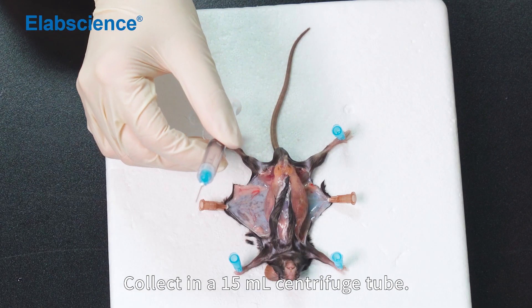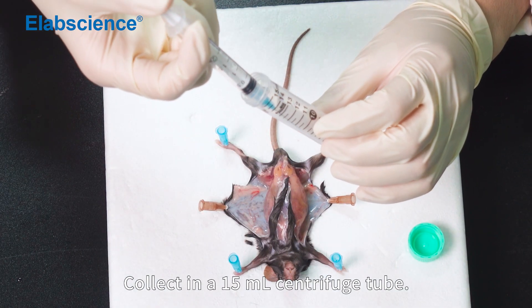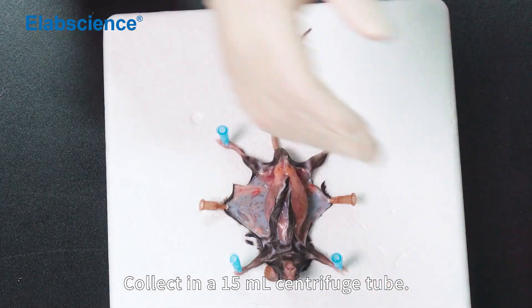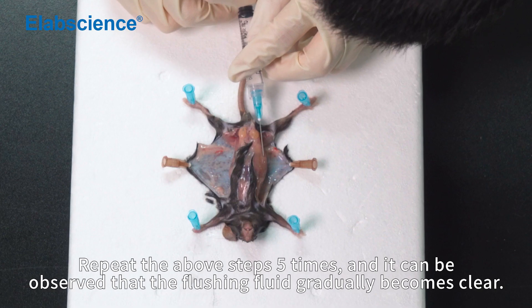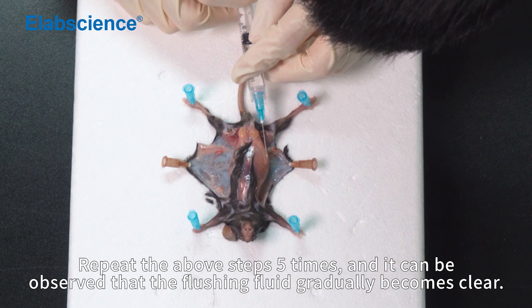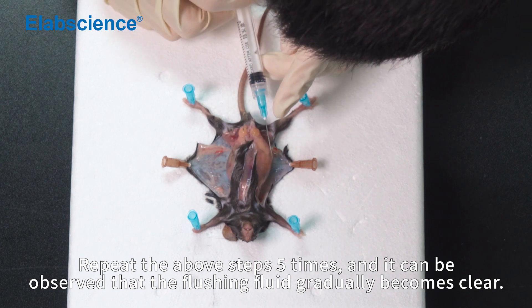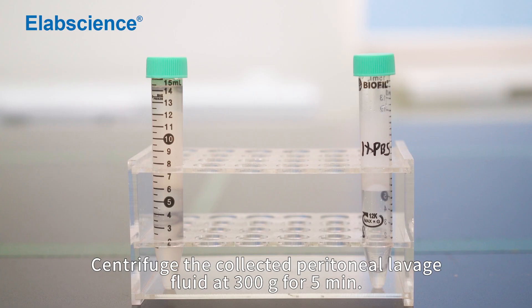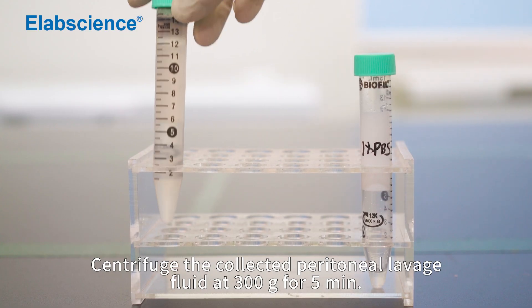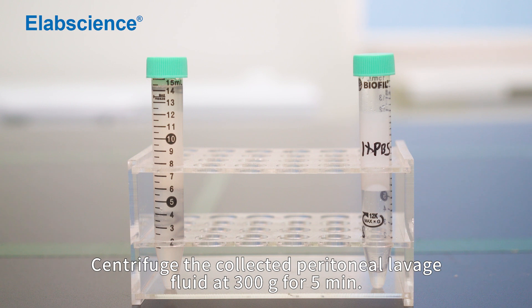Collect in a 15 ml centrifuge tube. Repeat the above steps 5 times; it can be observed that the flushing fluid gradually becomes clear. Obtain a single-cell suspension by centrifuging the collected peritoneal lavage fluid at 300 times gravity for 5 minutes.